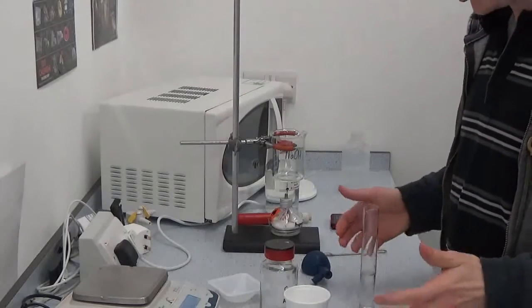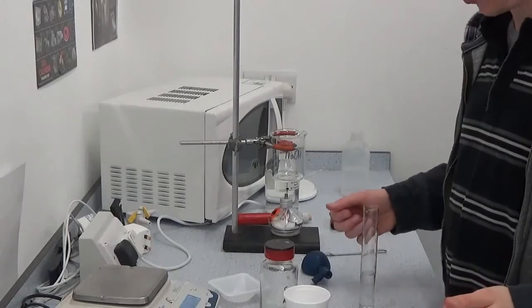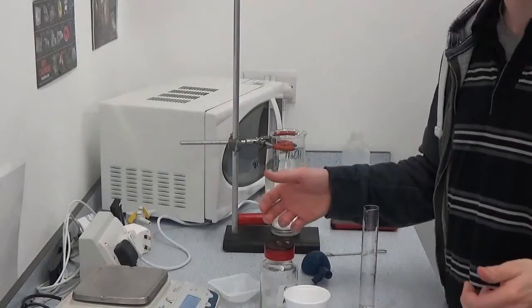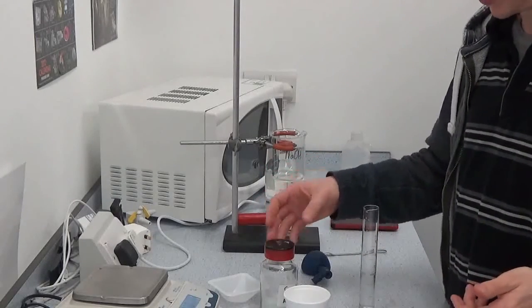Right, this is probably the dullest experiment you'll actually do, measuring enthalpy change, so the second required practical.